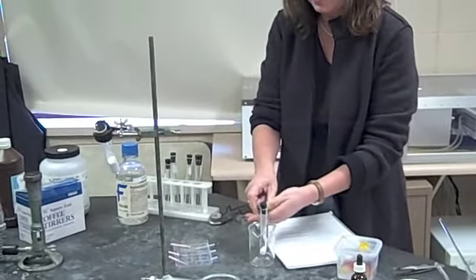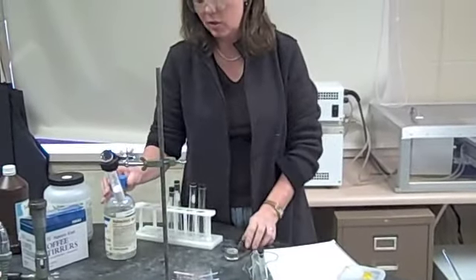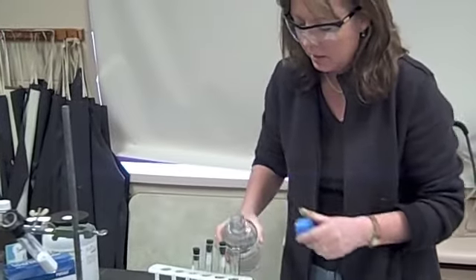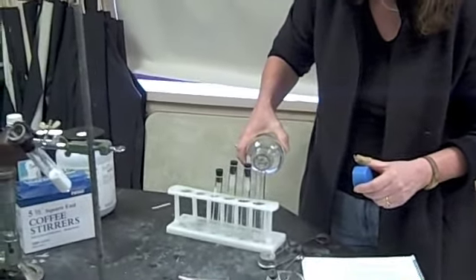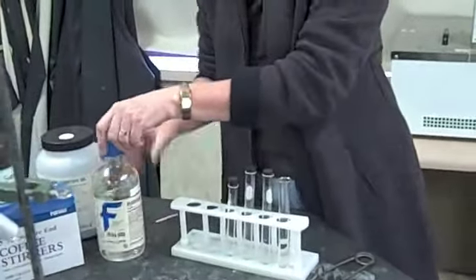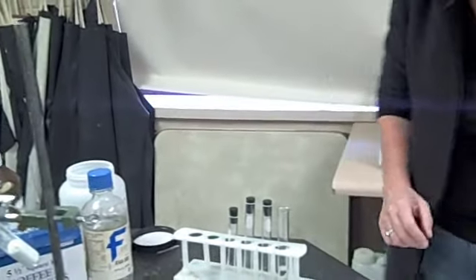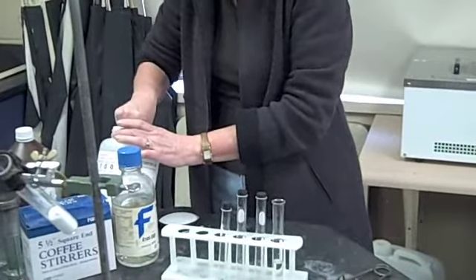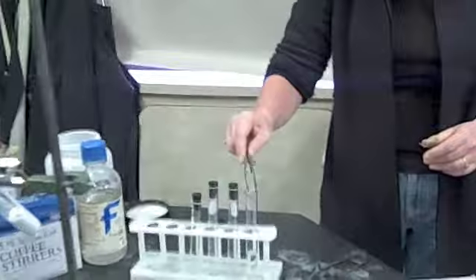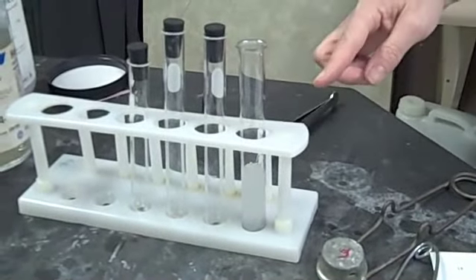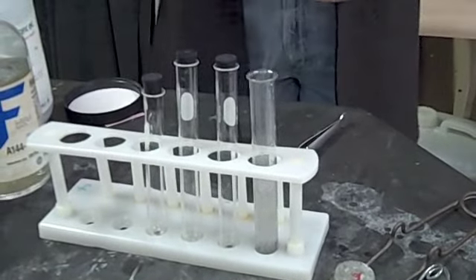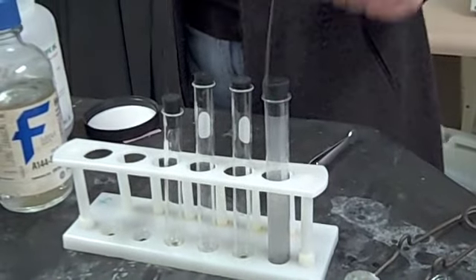Now the next one I want to show you is a fun one that the students like, but you need to exercise caution. So definitely have your test tube rack out when you're doing this one. If I'm testing for gas, let's say, for example, I'm going to add this liquid to this test tube. And I'm going to drop a piece of metal into the test tube.